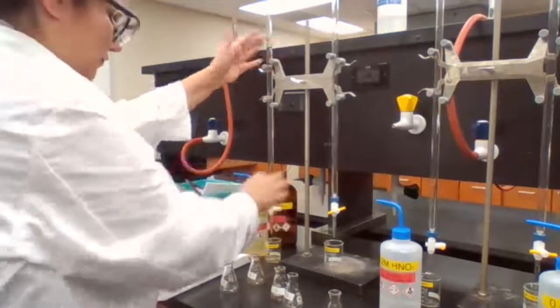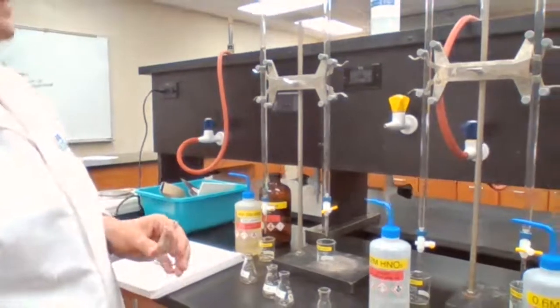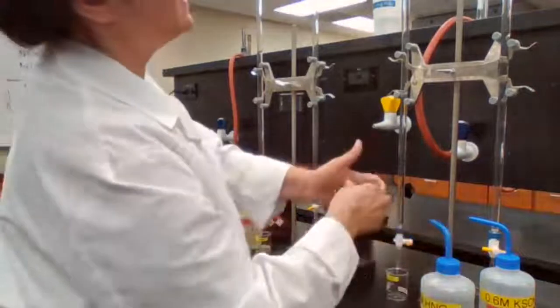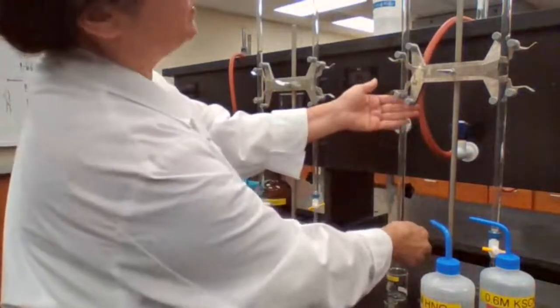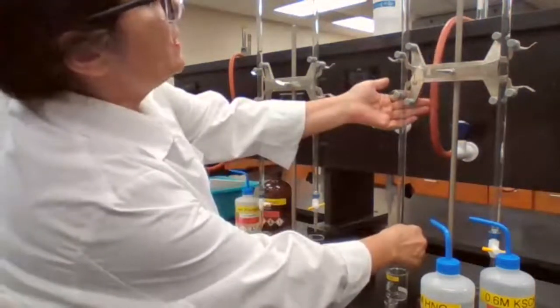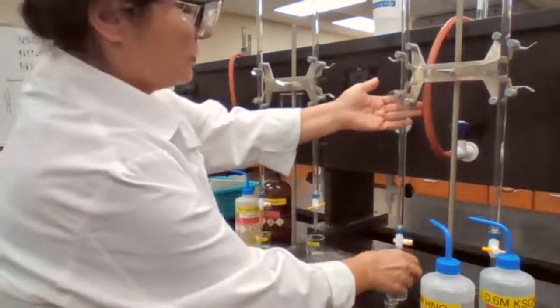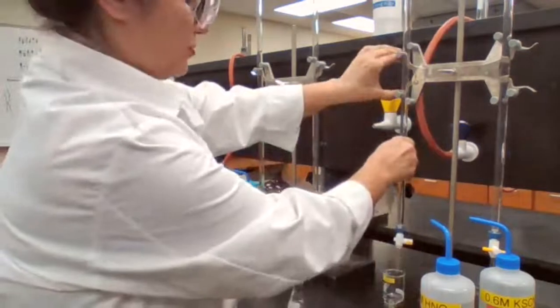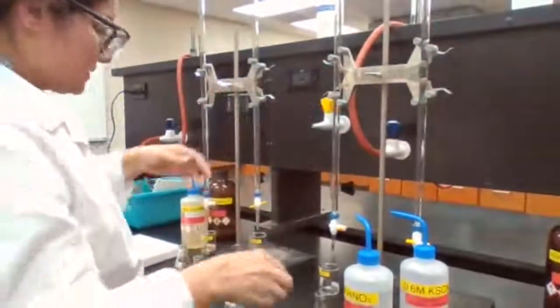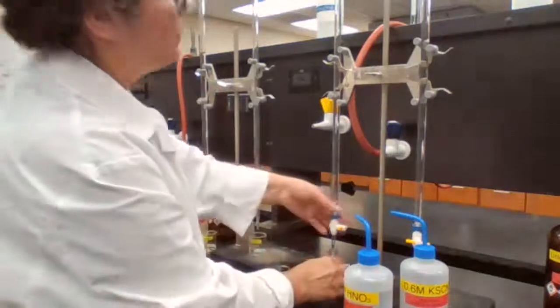Okay. So for A, I don't need any iron, so I'm adding nitric acid. Why should I add nitric acid, and how much? 5 milliliters of nitric acid. If you have iron, it could be iron 2 plus, it could be iron 3 plus. When you add nitric acid, it makes all the iron change to iron 3 plus. So when you are measuring iron 3 plus, you want to make sure that the iron is in the iron 3 plus form.